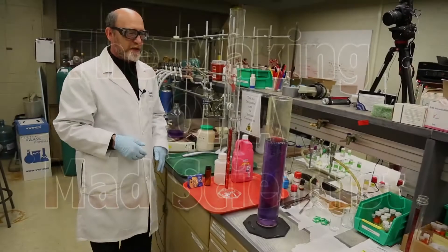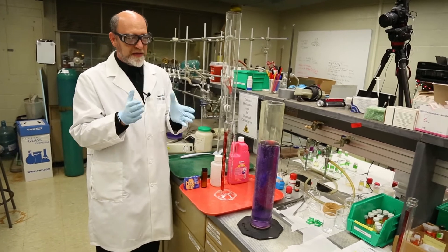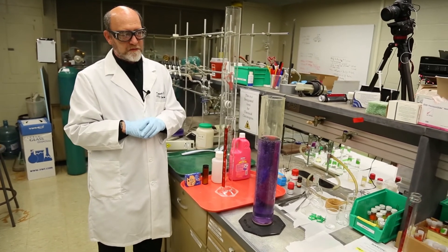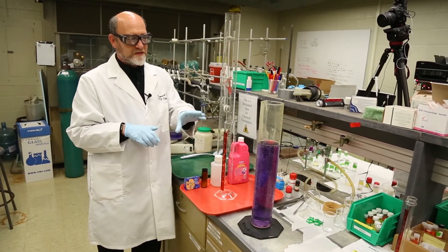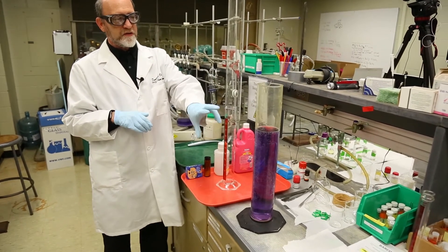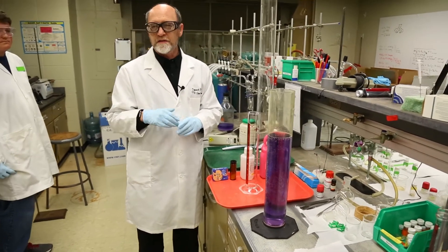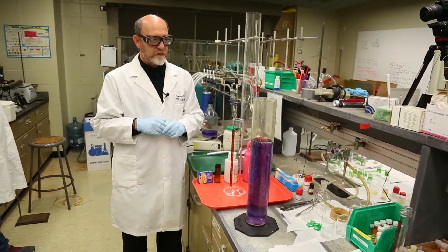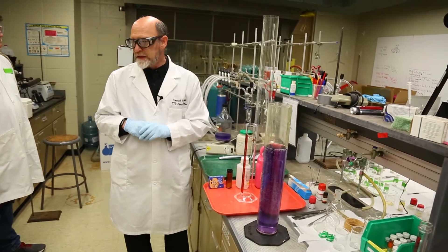This is a liquid that contains a base, essentially at the concentration of say Drano. And it's purple because we have an indicator that changes to the color purple in the presence of an acid or a base. Well, in this case, in the case of a base.